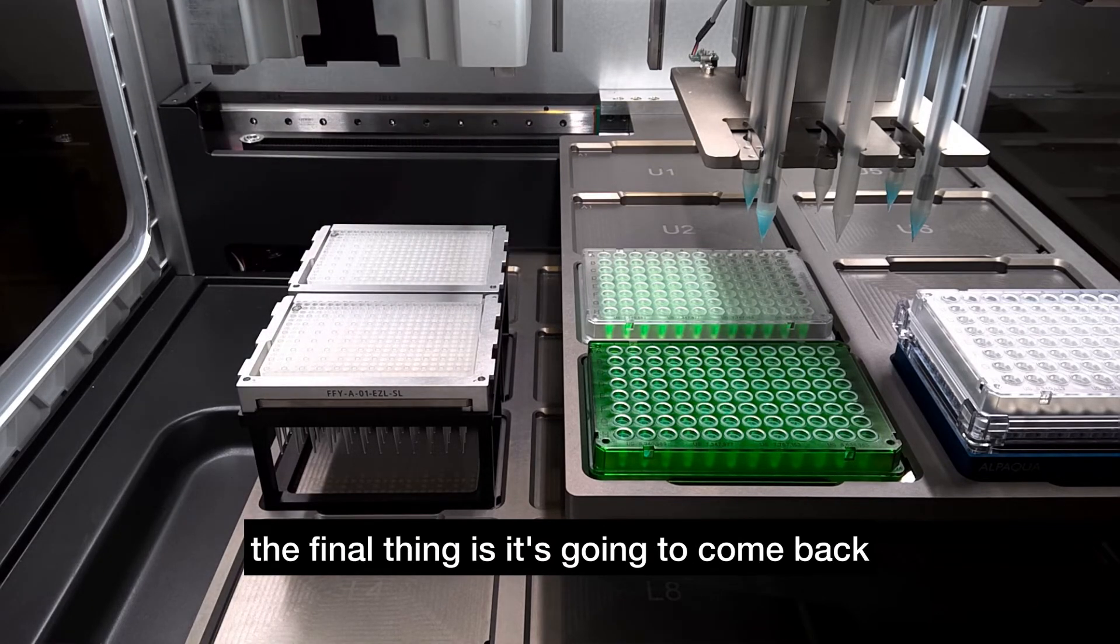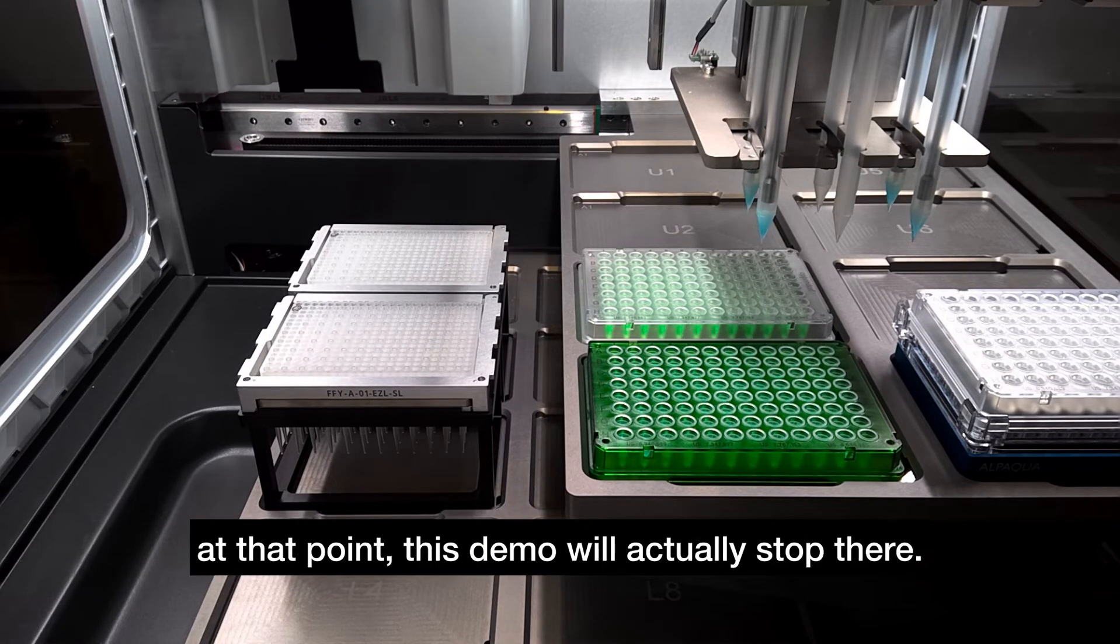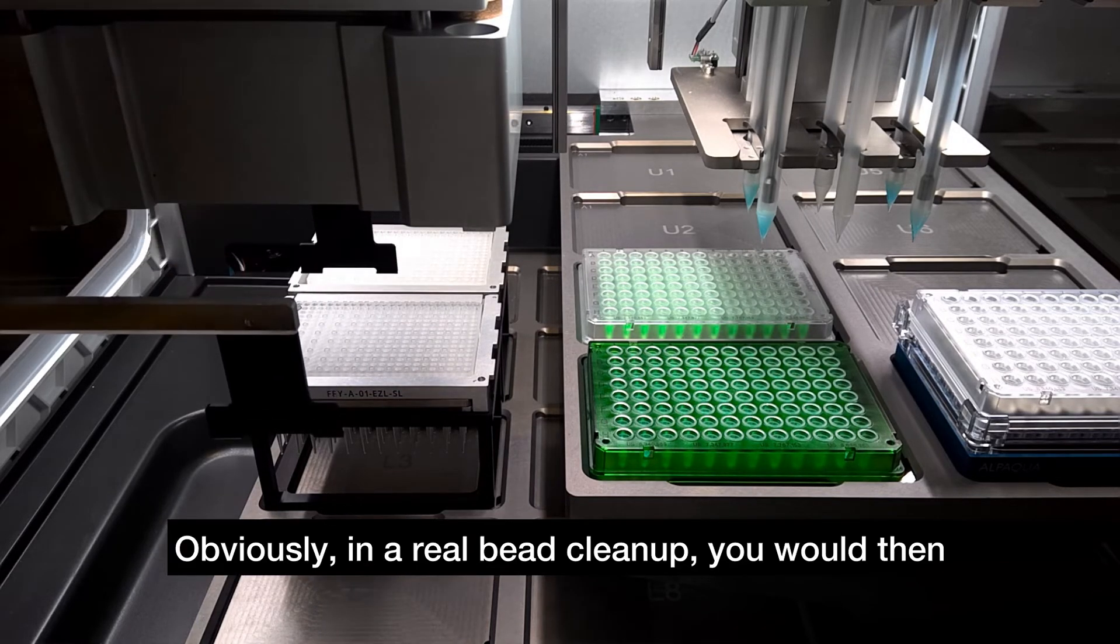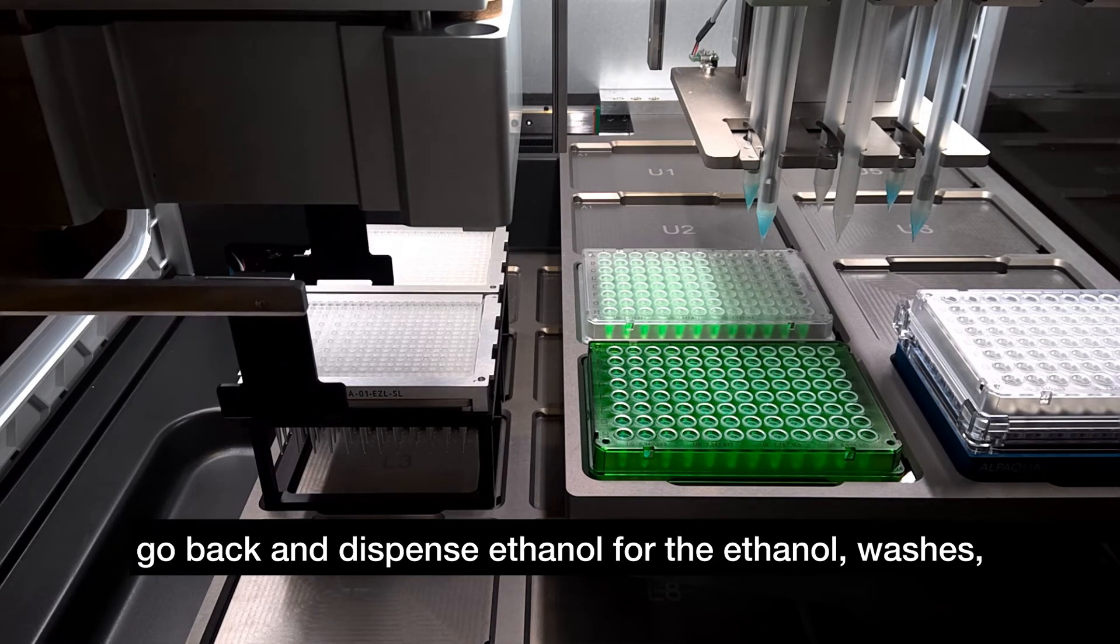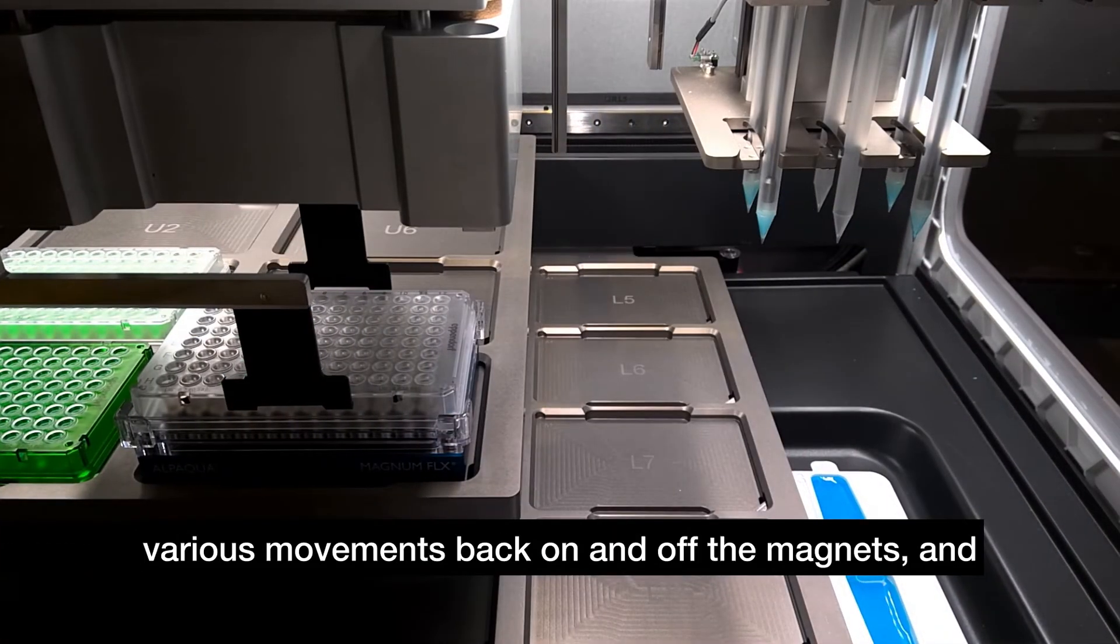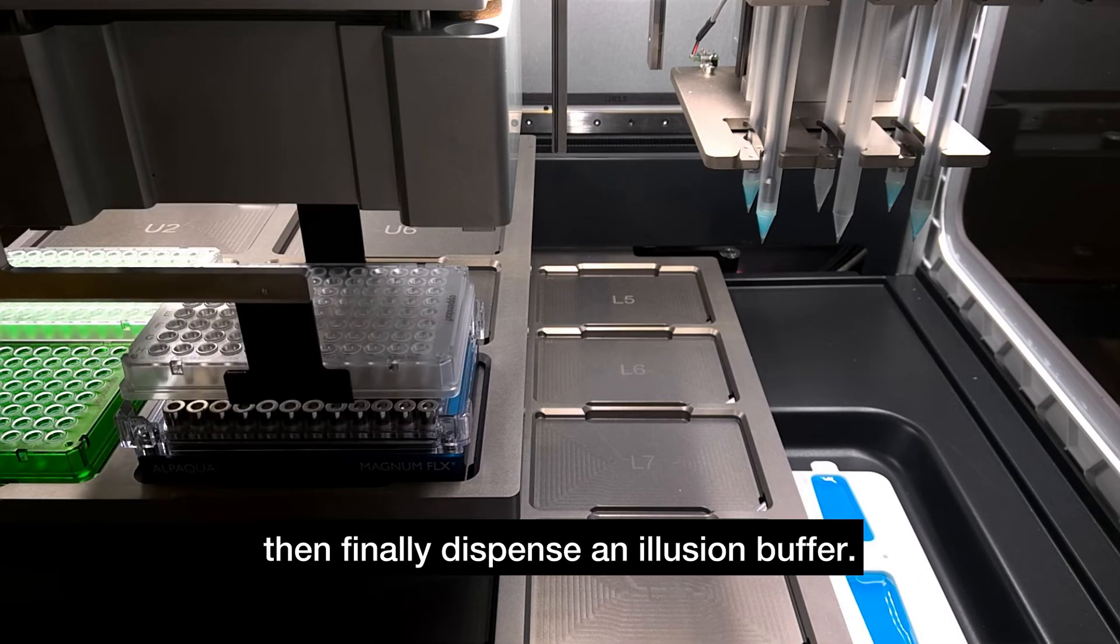And the final thing is it's going to come back and move that plate back to the deck. And at that point, this demo will actually stop there. Obviously in a real bead cleanup, you would then go back and dispense ethanol for the ethanol washes, various movements back on and off the magnets, and then finally dispense an elution buffer.